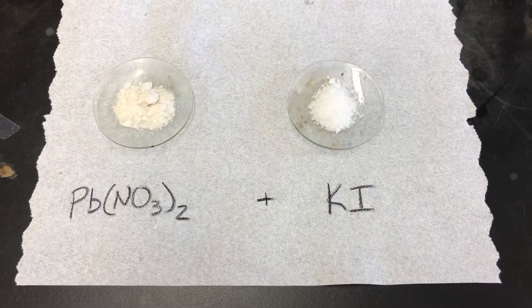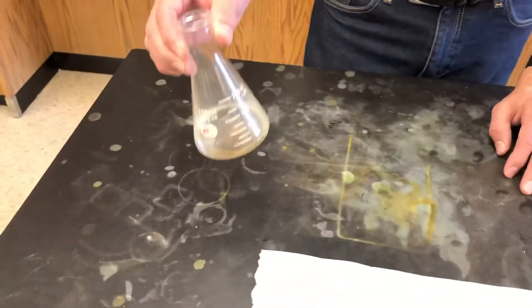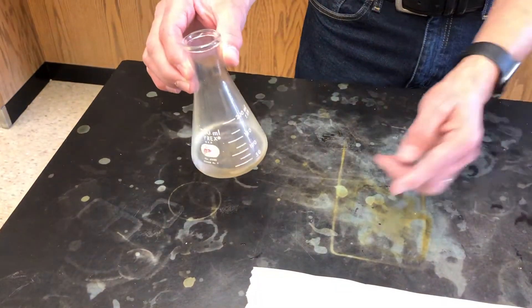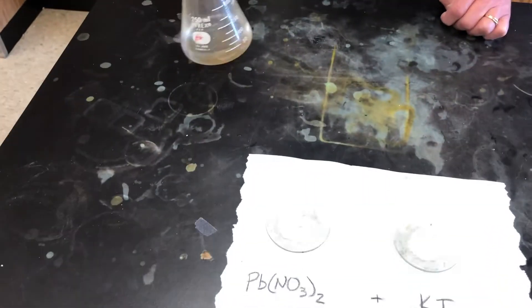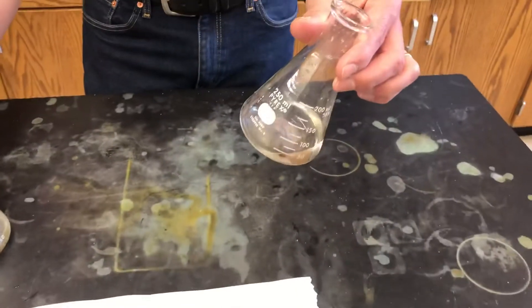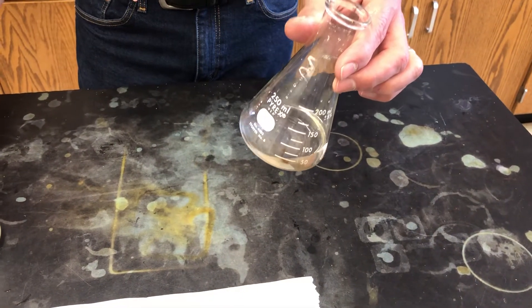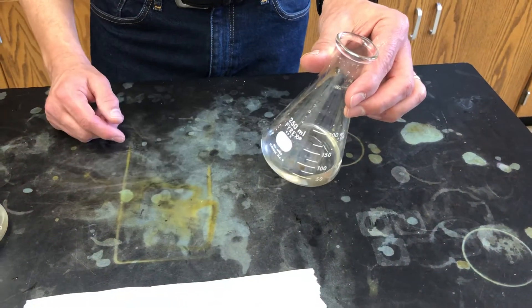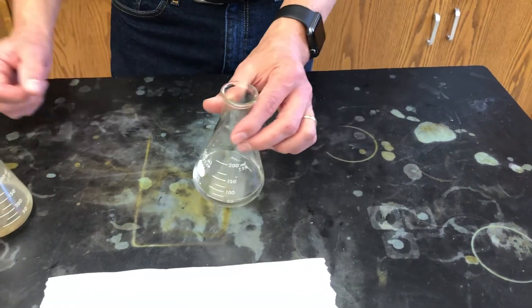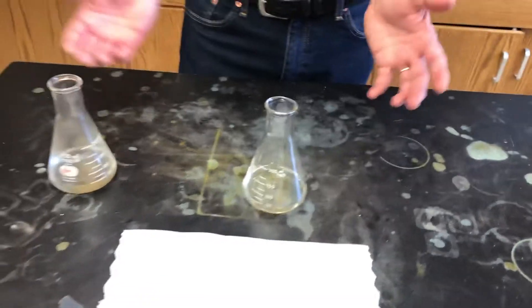You'll see that they're both white solids. Now in this Erlenmeyer flask I have some of that lead nitrate dissolved in water, and in this Erlenmeyer flask I have some of this potassium iodide dissolved in water, and what I'm going to do is combine them.